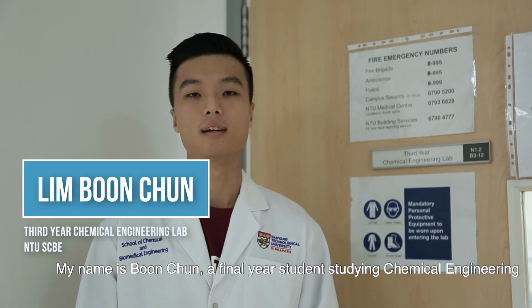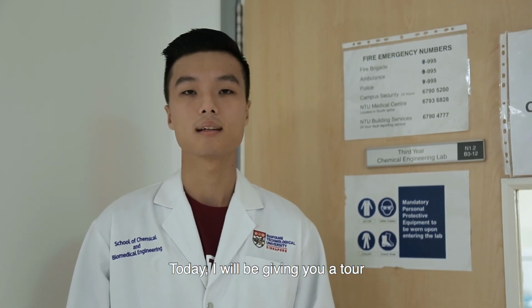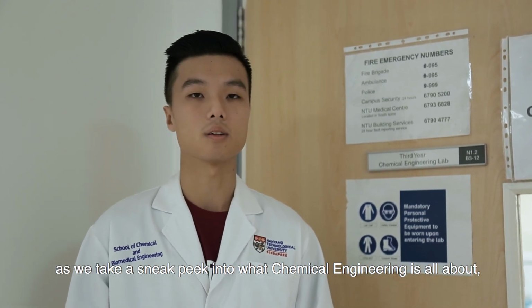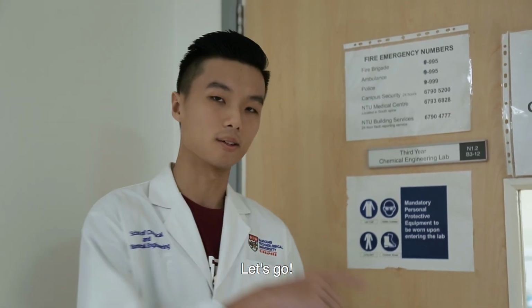My name is Boon Chun, a final year student studying chemical engineering, currently working on my final year design project. Today, I will be giving you a tour of our Year 3 chemical lab as we take a sneak peek into what chemical engineering is all about so that you can make a more informed decision should you decide to pursue chemical engineering as a degree. Let's go!